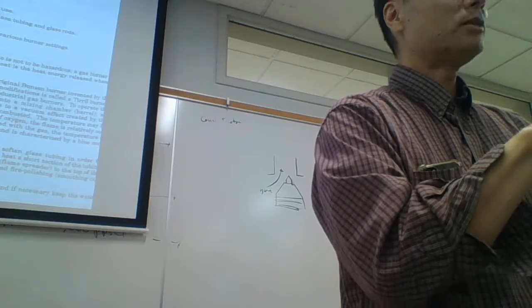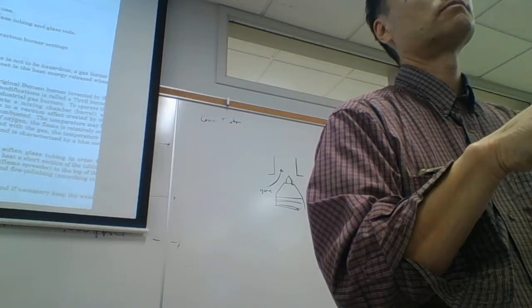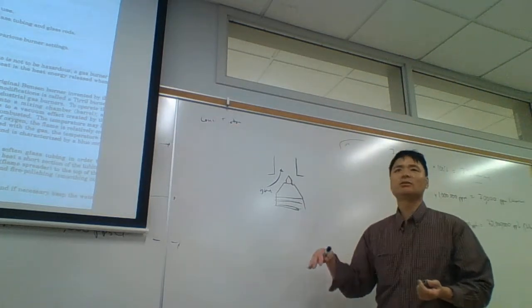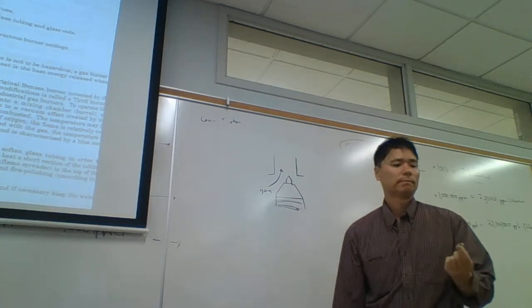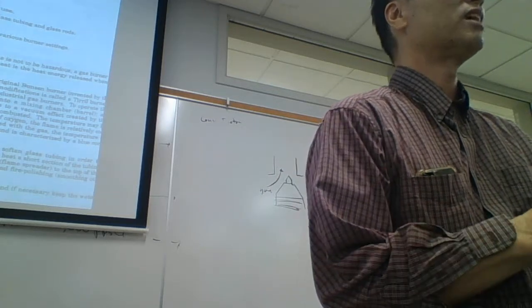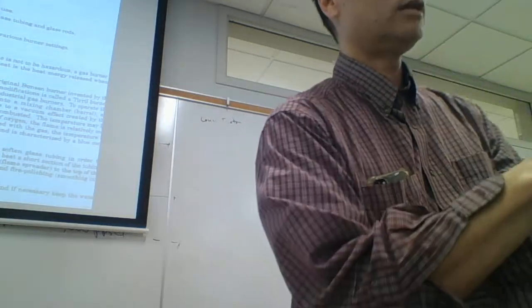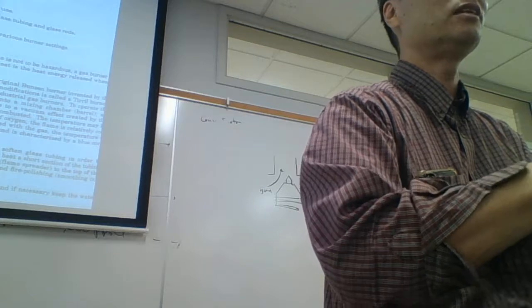This is not meant to shut off the gas. It's just meant to fine-tune the gas. And by denting this, you just screwed it up because it can't fine-tune it as well as it did before. You know? So I just wanted you to take it out so you could see a damaged needle valve. This is a damaged needle valve. The needle valve, again, you could gently close it, but a lot of people just crank on it to shut off the gas. No, you don't do that.